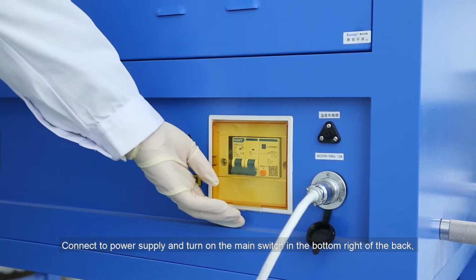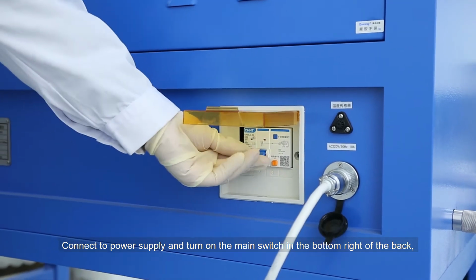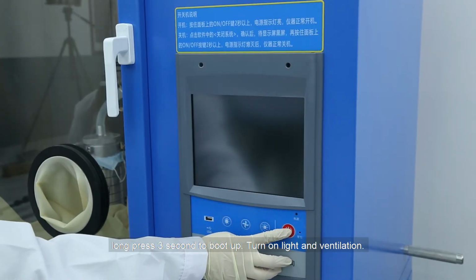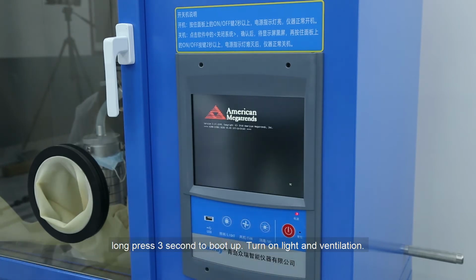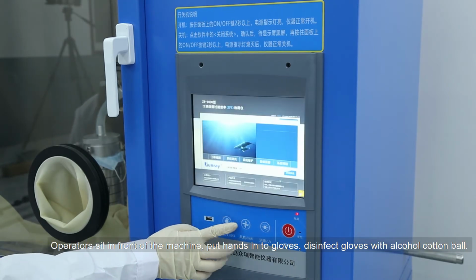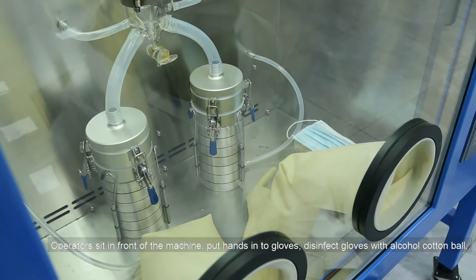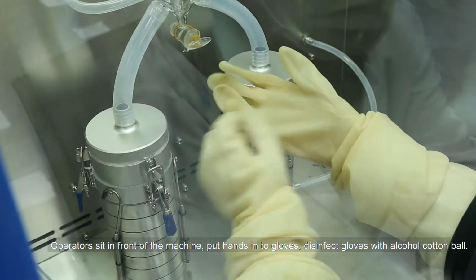Connect the power supply and turn on the main switch in the bottom right of the back. Long press 3 seconds to boot up. Turn on the light and ventilation. Operators sit in front of the machine. Put hands into the gloves. Disinfect the gloves with an alcohol cotton ball.